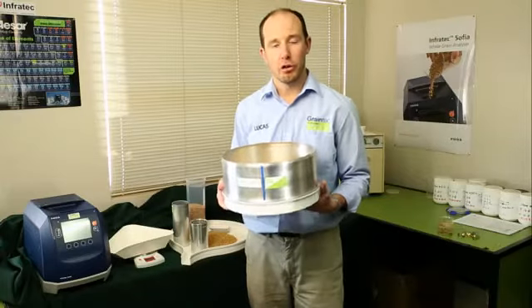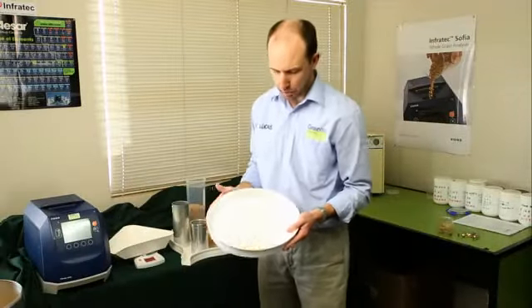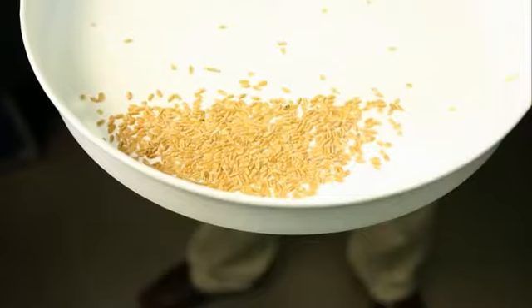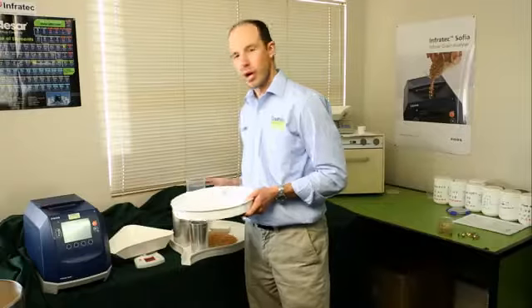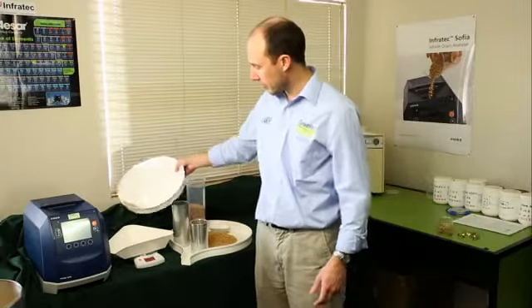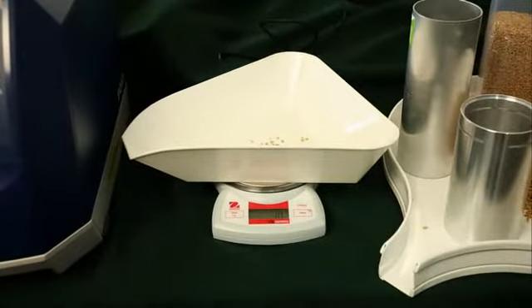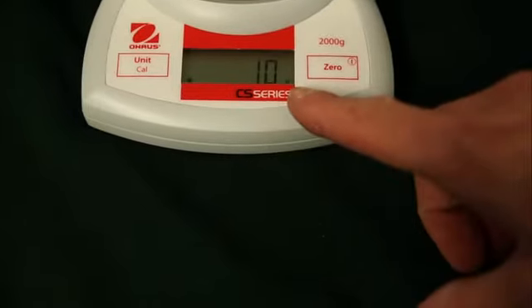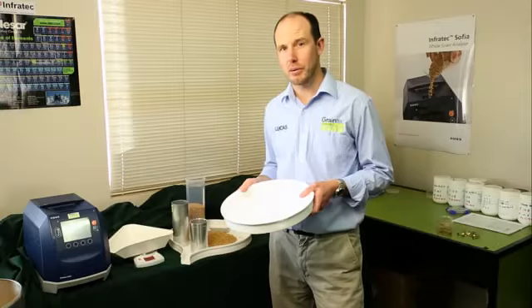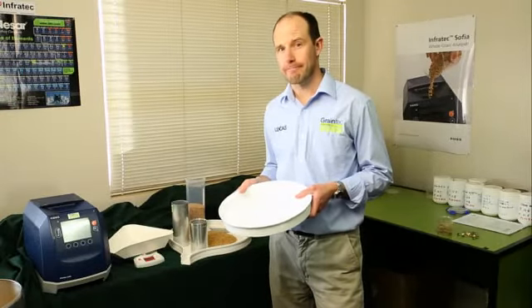When you've completed your 40 shakes, you can remove the top part of the screen, and we're going to weigh the screenings. So I have my plastic container tared on the weighing balance. I'm going to place the screenings in the plastic container. 10 grams divided by 411 grams gives us a screening percentage of 2.4%.